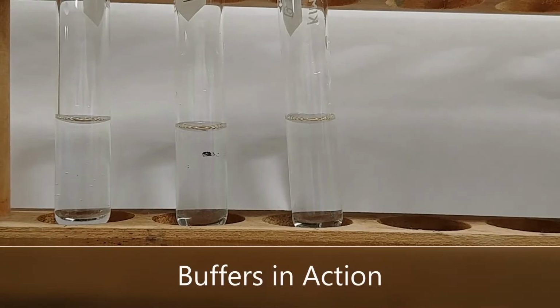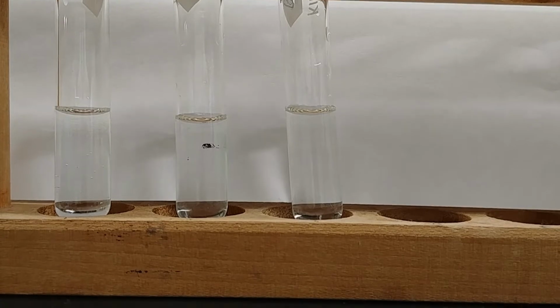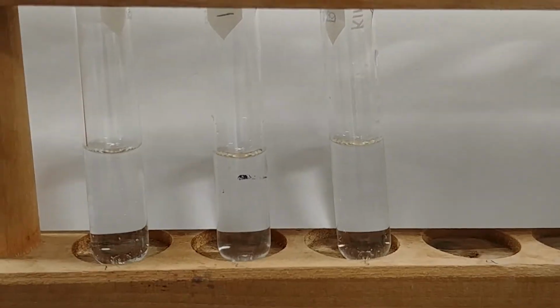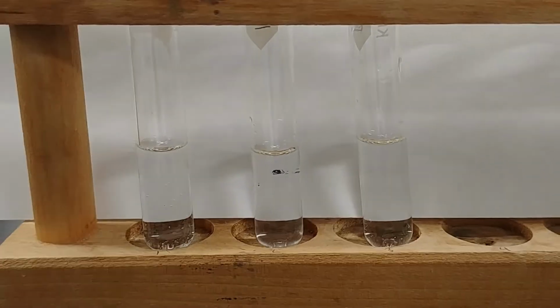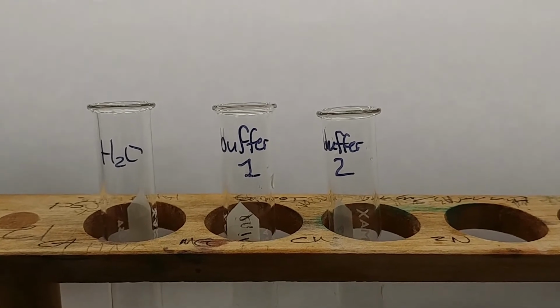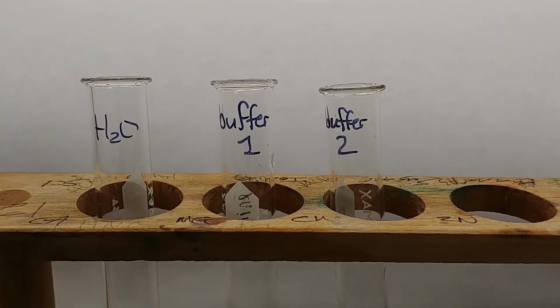Here we go. We're going to take a look at some buffers and compare them to water in terms of how they respond to the addition of acid or base. So this is something that we refer to as a buffer action. Now, in these 3 test tubes, I have just plain old tap water, buffer 1 and buffer 2.